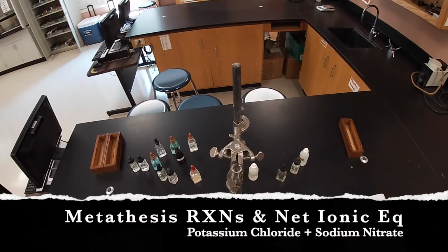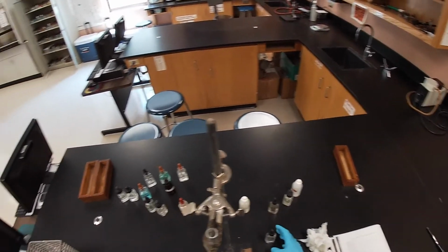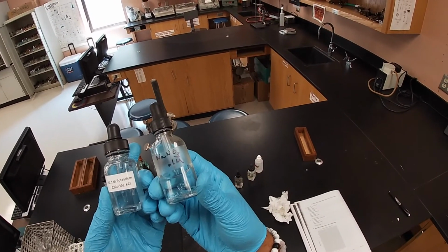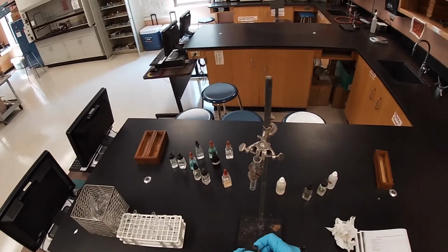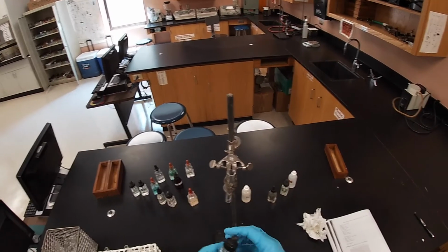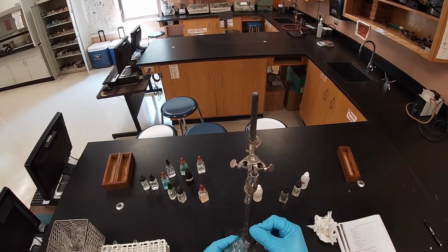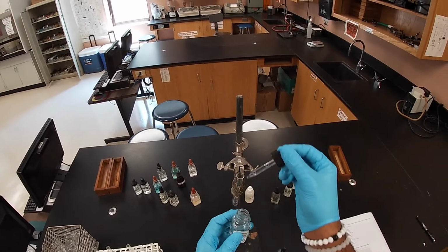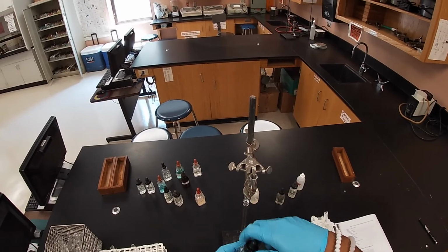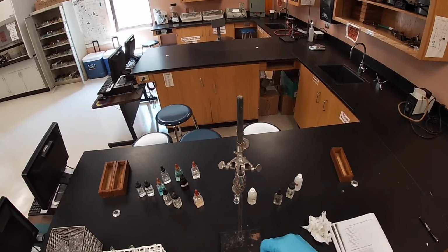Okay, we're coming to our last and final reaction. This reaction is going to be between potassium chloride, hopefully you can see it, and sodium nitrate. And so we're going to do the same process. We're going to add a dropper full of each into our test tube setup. This is reaction 16. So we've added the potassium chloride. Now we're going to add the sodium nitrate.